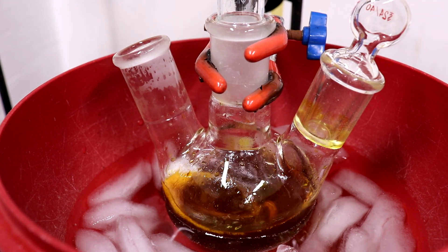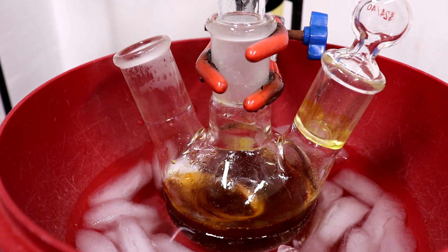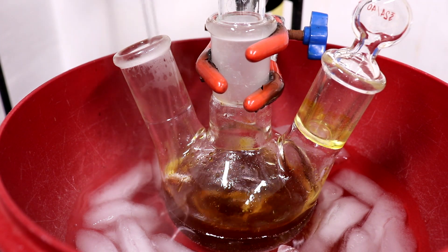Solid built up where the acetic anhydride was dripping into the flask, so I knocked it down before continuing.